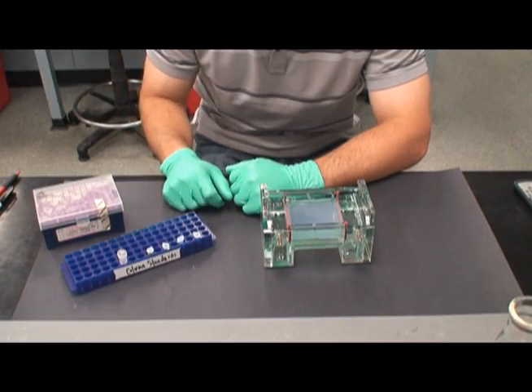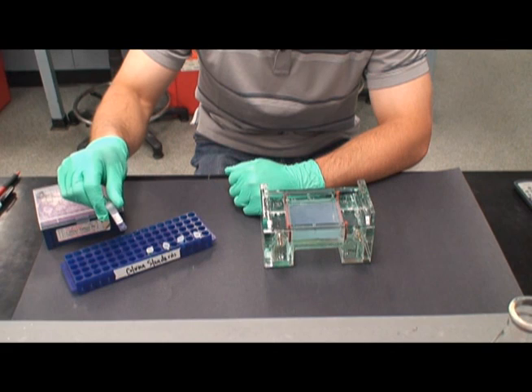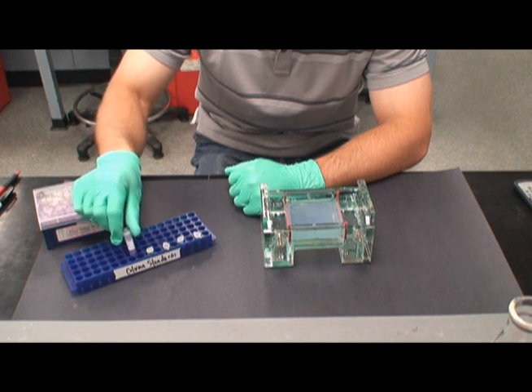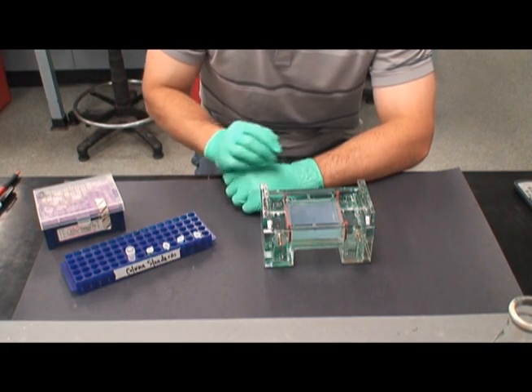In addition to the four samples, hyperladder will also be placed into one of the wells. Hyperladder is a known DNA size marker and can be used as a reference.